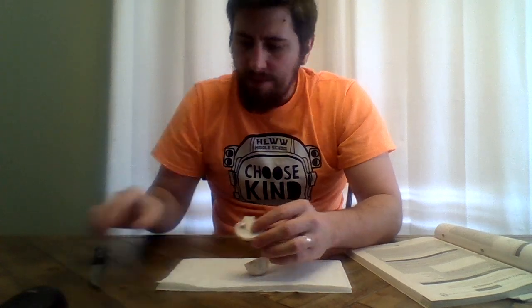Now we're going to use a knife to cut through the middle of the mushroom. Wow, amazing, right? Classic mushroom you'd put on a pizza. Okay, and it's a little tough. I'm actually going to cut this part in half again.